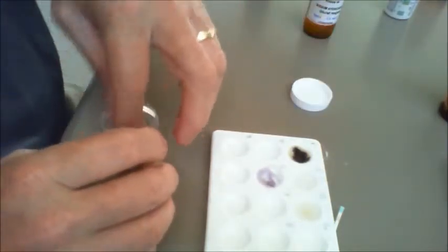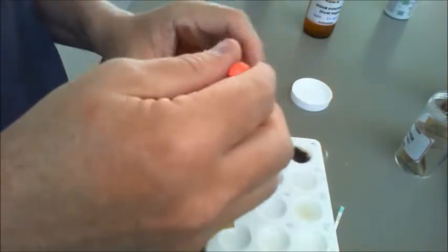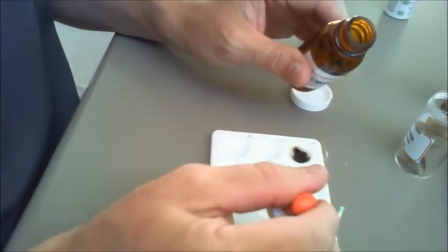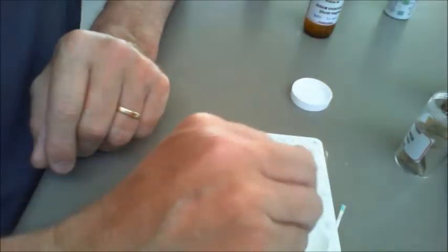The final one that we have is this particular one here, and this is the fats test, and I call this the McDonald's test simply because we've all seen fast food bags that have had the fat from the food sort of work their way through it. So we do exactly the same thing. So we place a little bit in there.